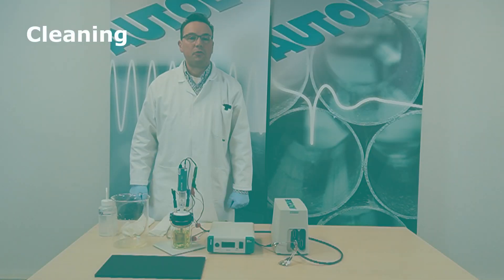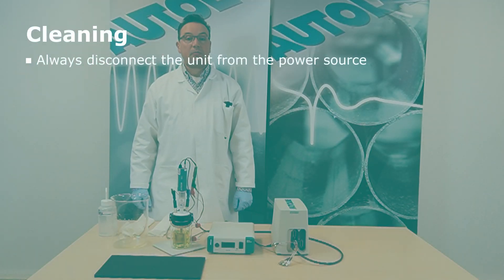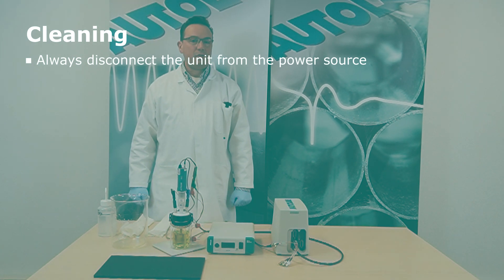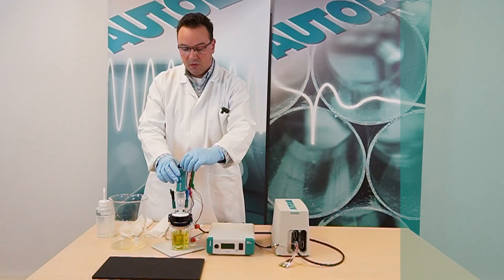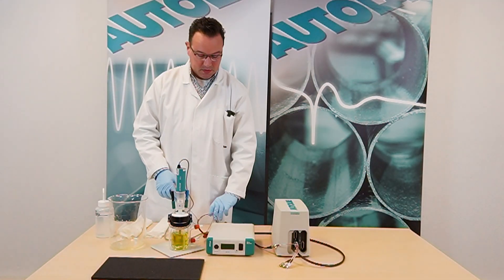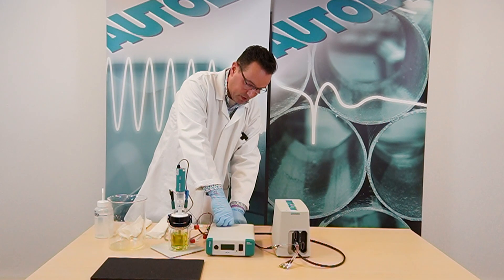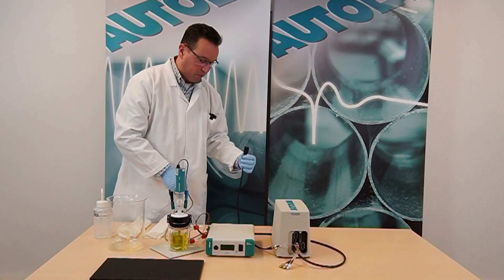Always disconnect the motor control unit from the electrical power source before cleaning. Never use excessive amounts of water, as it may damage the instrument. So first we disconnect this one and also we remove from the power source.